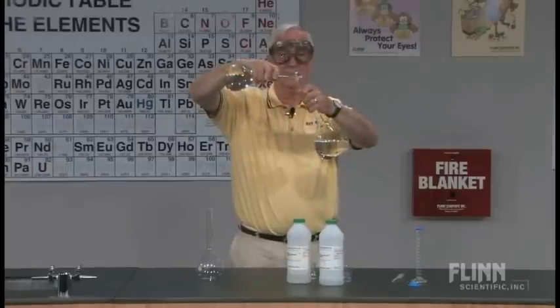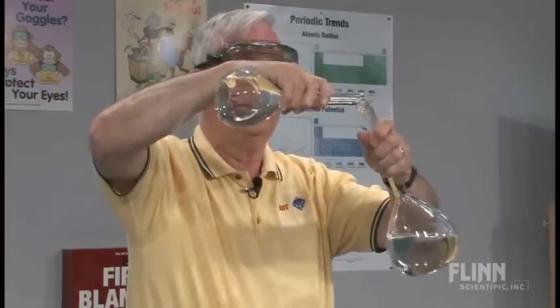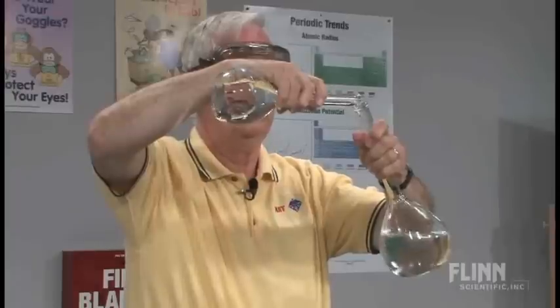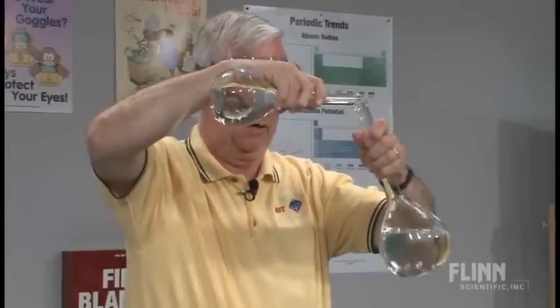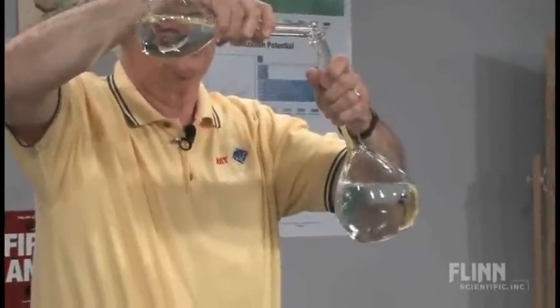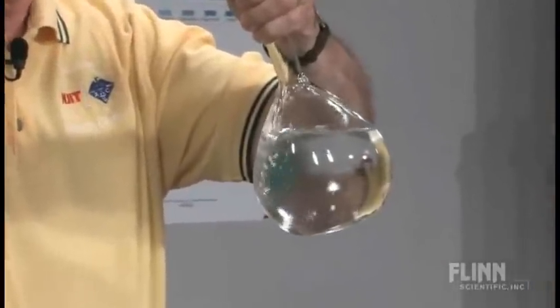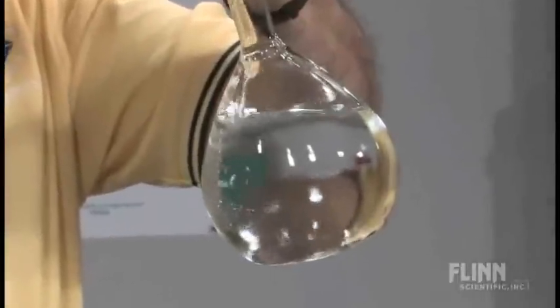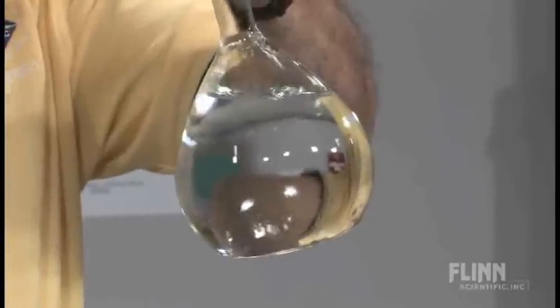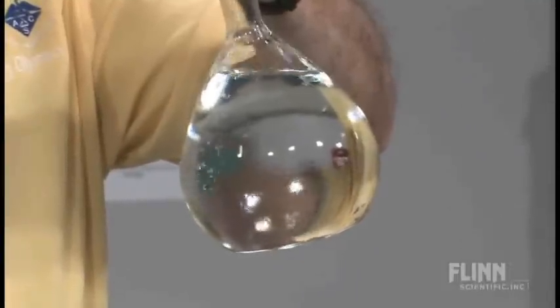Now adding the acid, we will see in the flask some of the mixing taking place where the reaction is actually occurring. The hydrochloric acid — hydrogen chloride — is reacting with the sodium hydroxide, and we get a reaction. Notice again that there is this mixing effect where you can see the two solutions mixing.